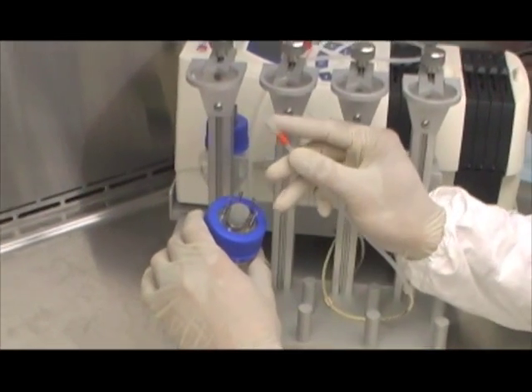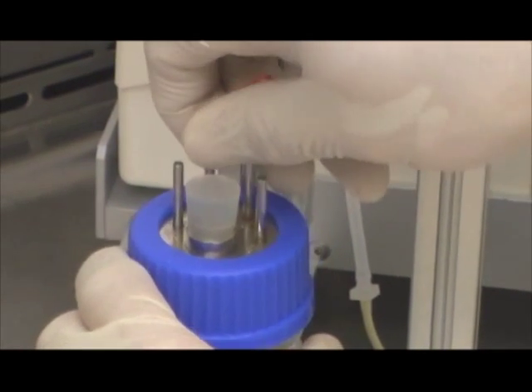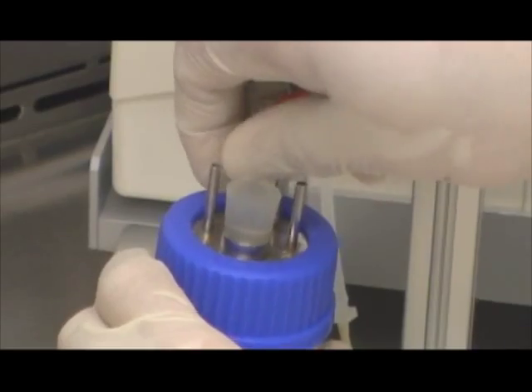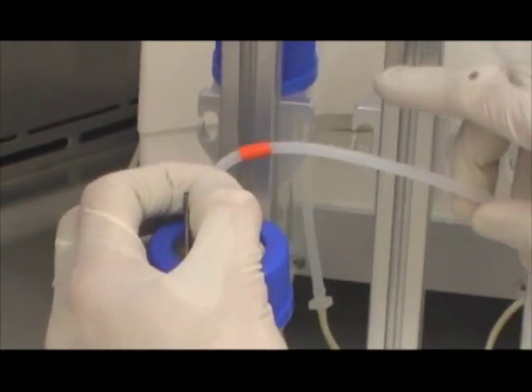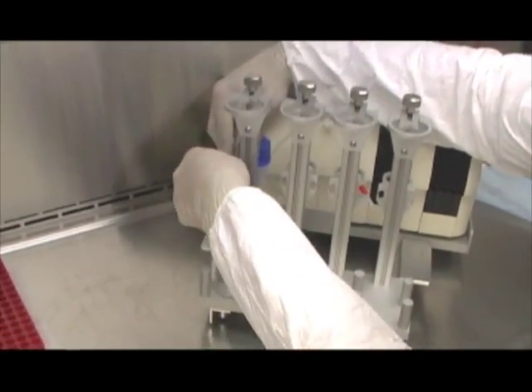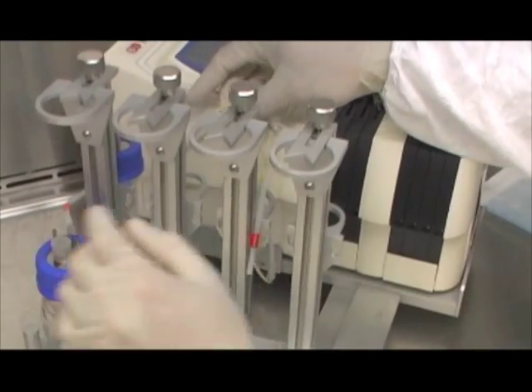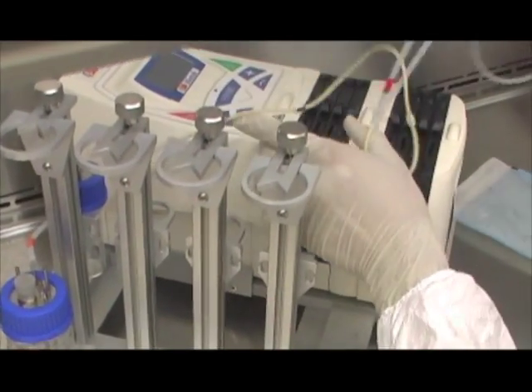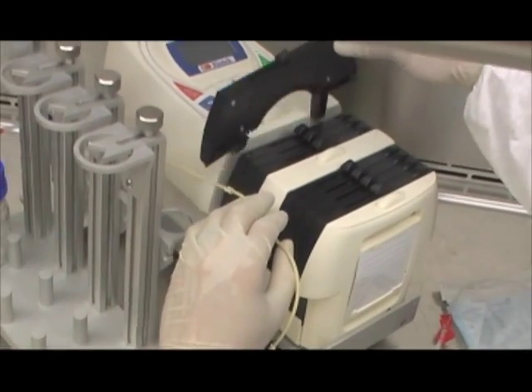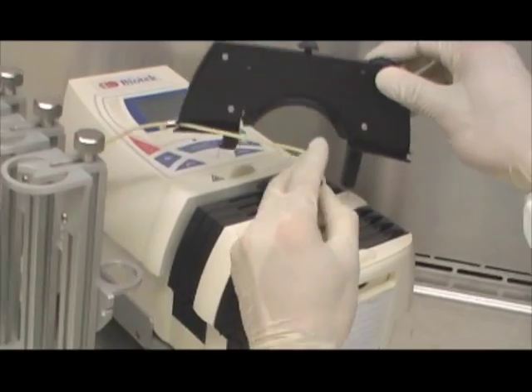To assemble the media perfusion tubing, take the orange-labeled end tubing and press-fit it on the metal peg with the letter O for orange. Unwind the perfusion tubing and secure it on the left hook on the side of the aluminum stand. Continue to unwind towards the peristaltic pump. From left to right, unhook the first pump cassette by applying downward pressure on the distal end. Lift the cassette and place the peristaltic tubing along the length of the bioreactor using the tubing's plastic stoppers.